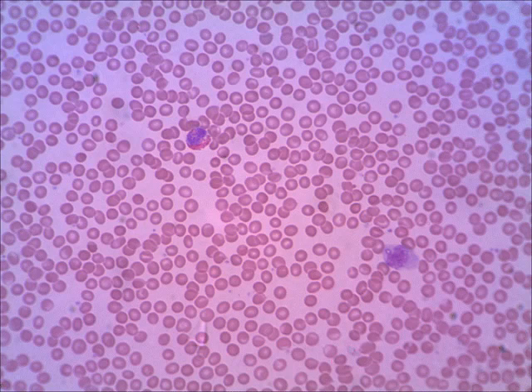And then here's our last slide. You tell me, what's this cell at the top here I'm pointing to? You see the red granules? That's just the giveaway. That's the eosinophil. And then this one on the right, this is a great one. That's a monocyte.